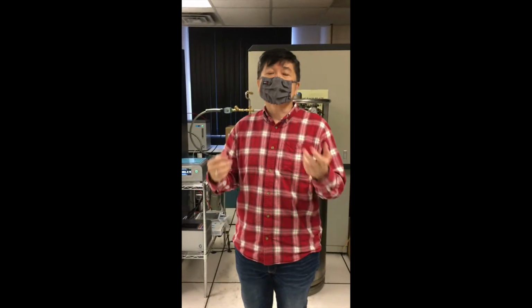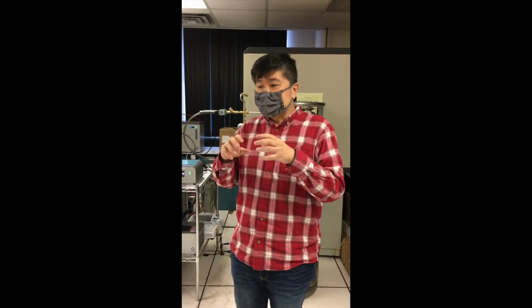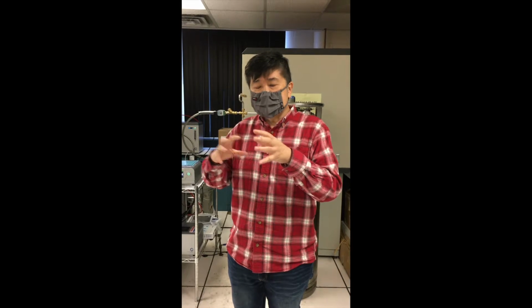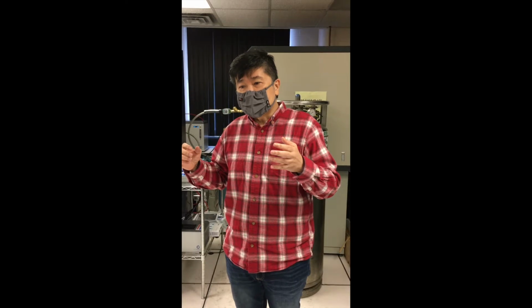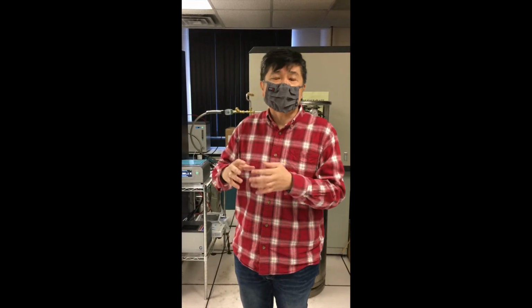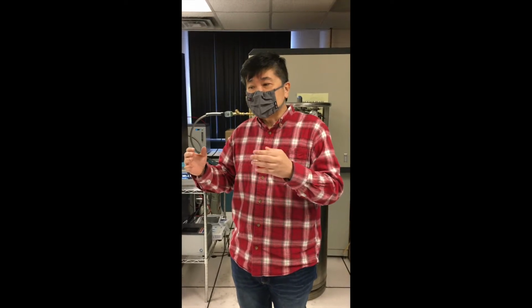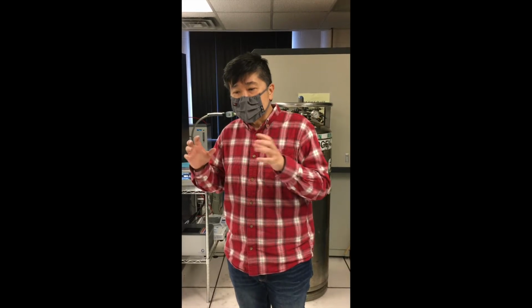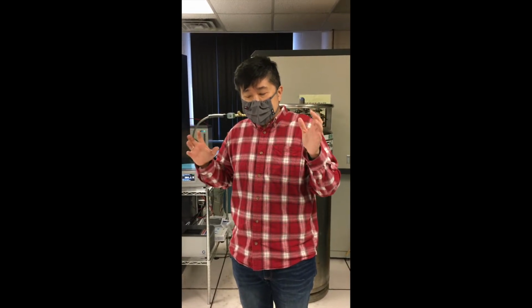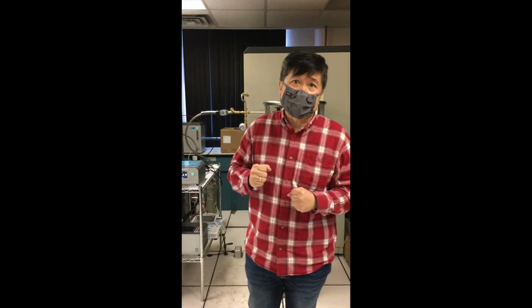electromagnetic radiation, which are waves, then what happens is that you're going to have interference in the crystal, right? And the resulting waves that are coming out of your crystal will either be constructively interfering with each other, in which case you'll have a reinforcement of the wave front, or they will cancel each other. So if that's what we're doing, then we now have a pattern called a diffraction pattern.